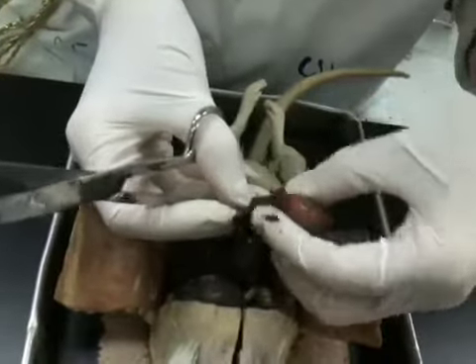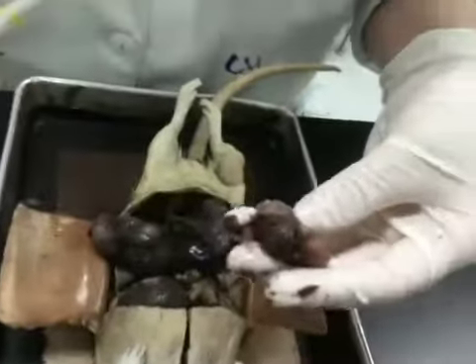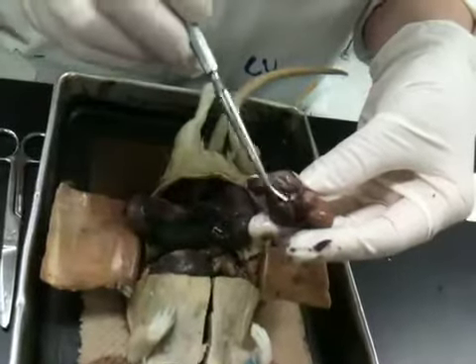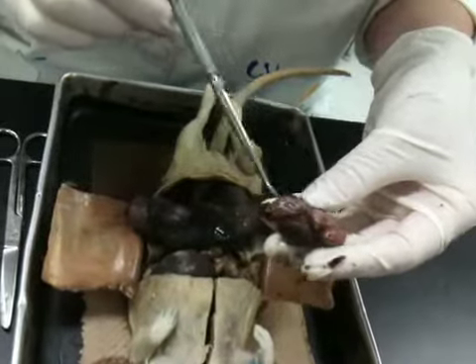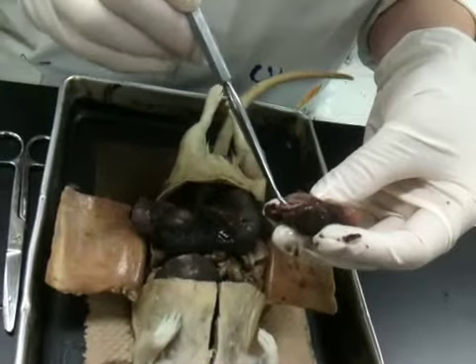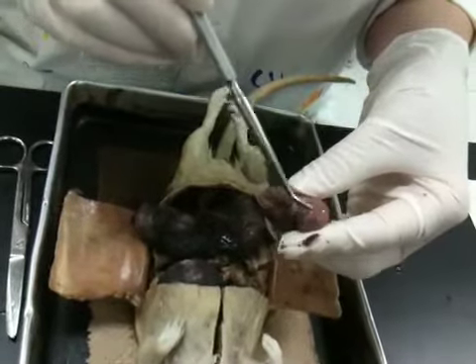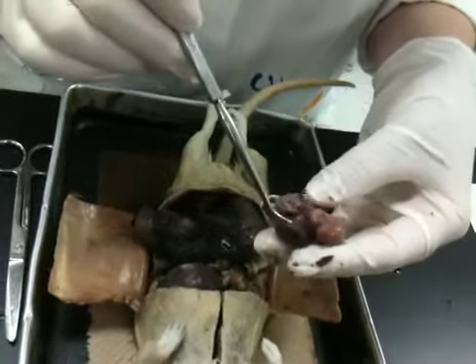The placenta is this disc-like flat pancake thing. So here is the placenta. Here's the fetus. You can see, here's the tail right there. Here's little feet. Right? There's a little baby. Right? So you need to call it a fetus.